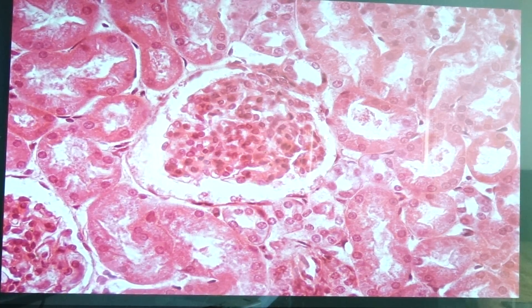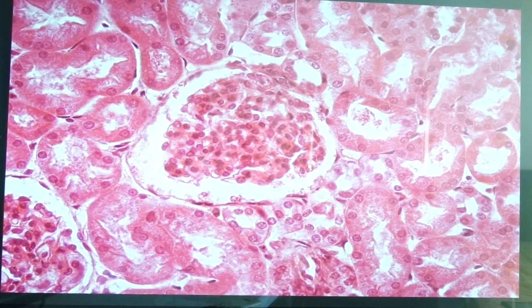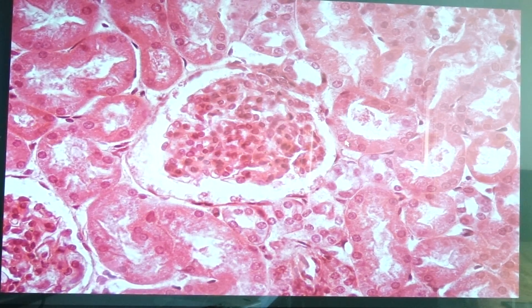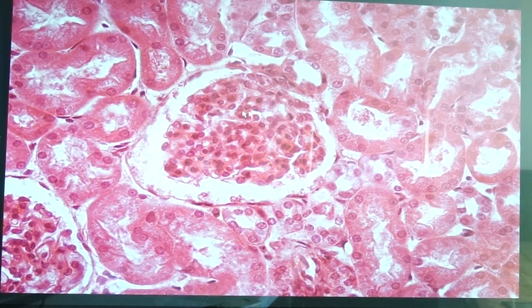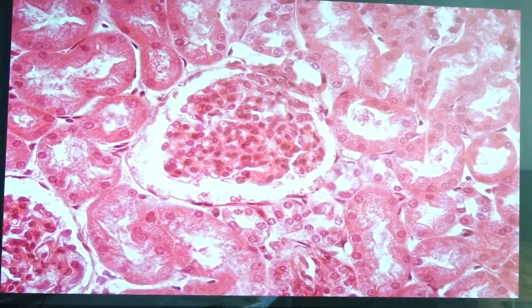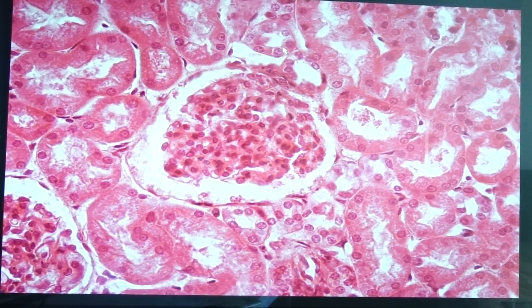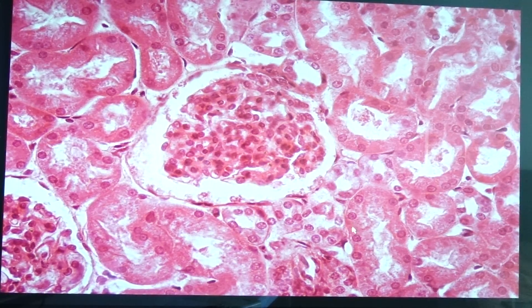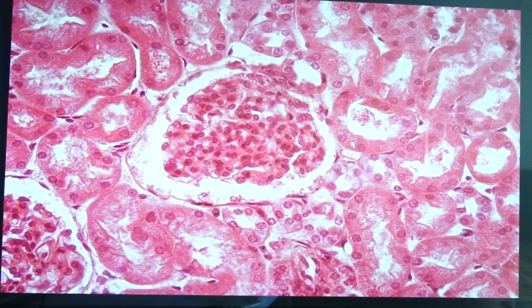With regards to the different tubules that you would see, there are mainly two forms: the distal convoluted tubule and the proximal convoluted tubule. The proximal convoluted tubule is identified by having a more acidophilic cytoplasm; the cuboidal cells lining them appear larger and they possess microvilli. The distal convoluted tubule appears to have less intense color of the cytoplasm, smaller cells lining them, and they do not have microvilli. Also, some cells show the presence of basal striations in the proximal convoluted tubule.